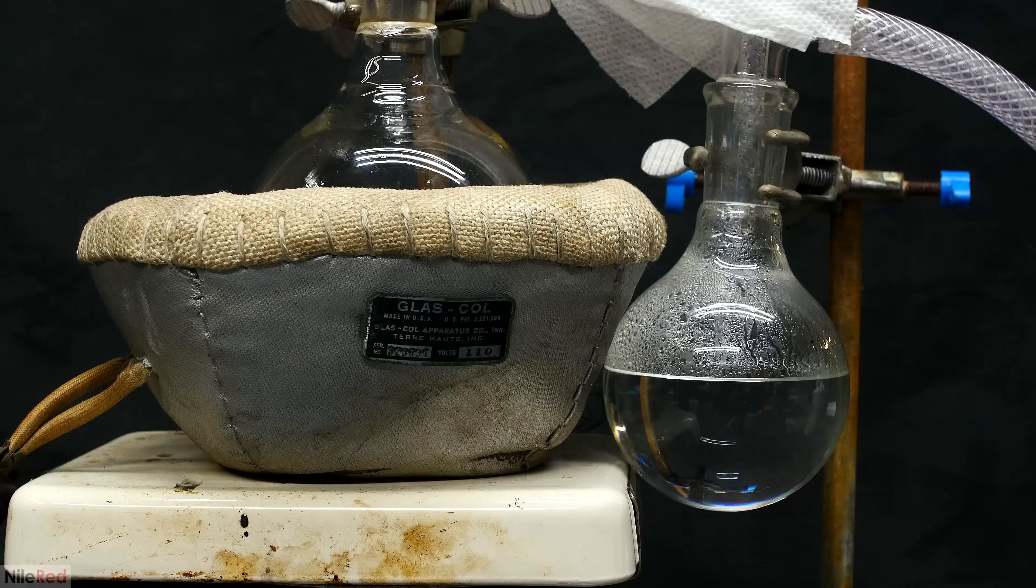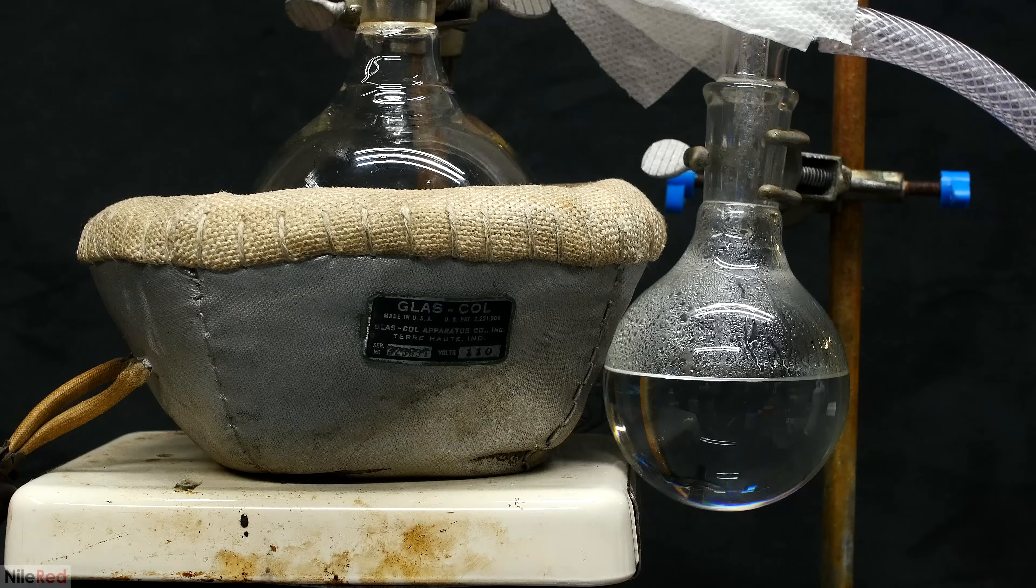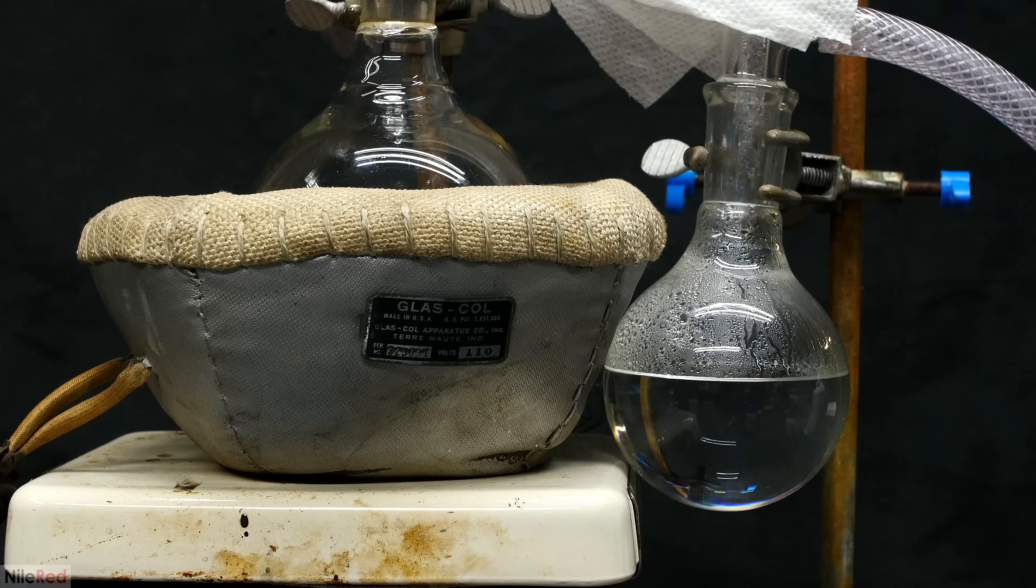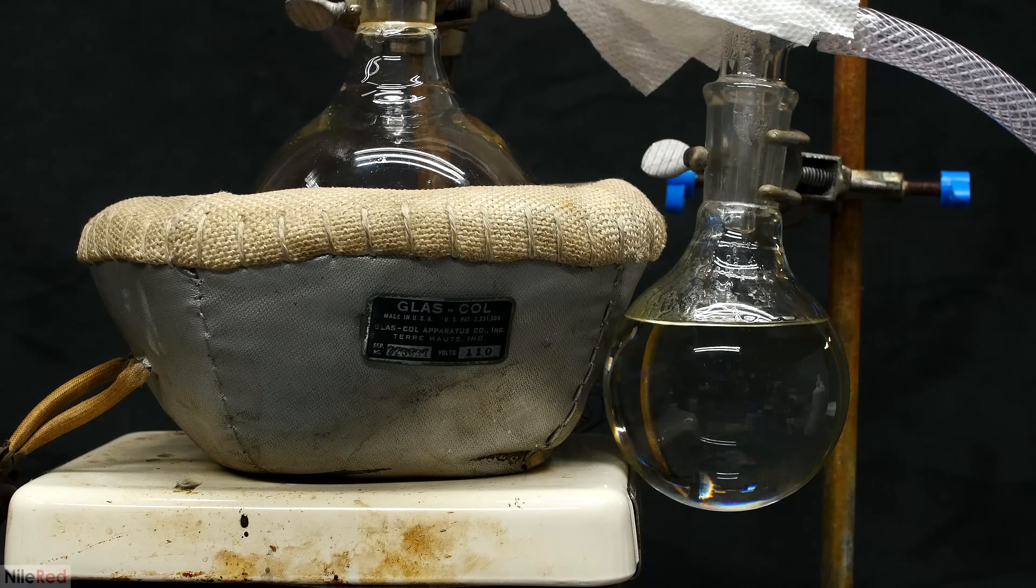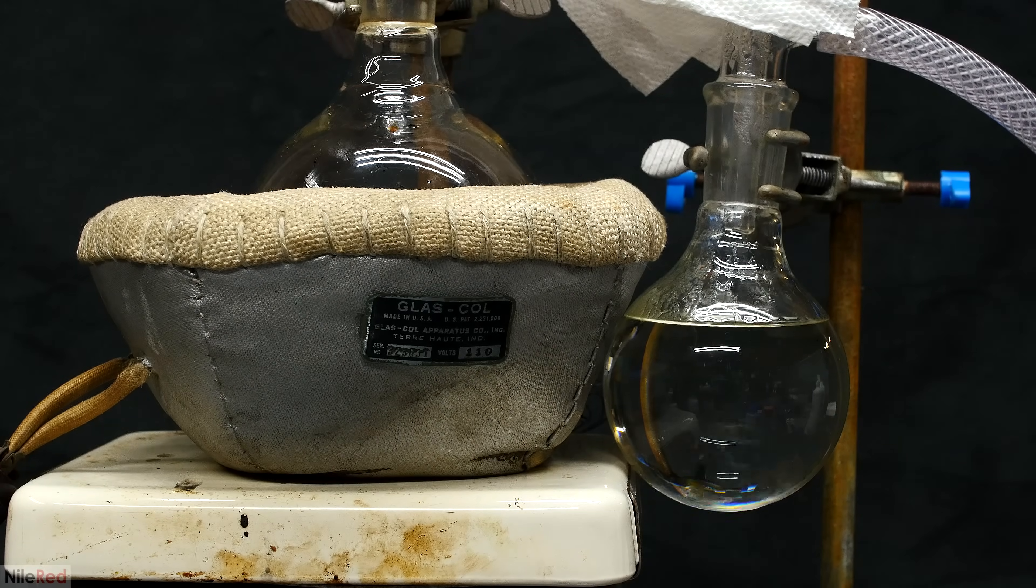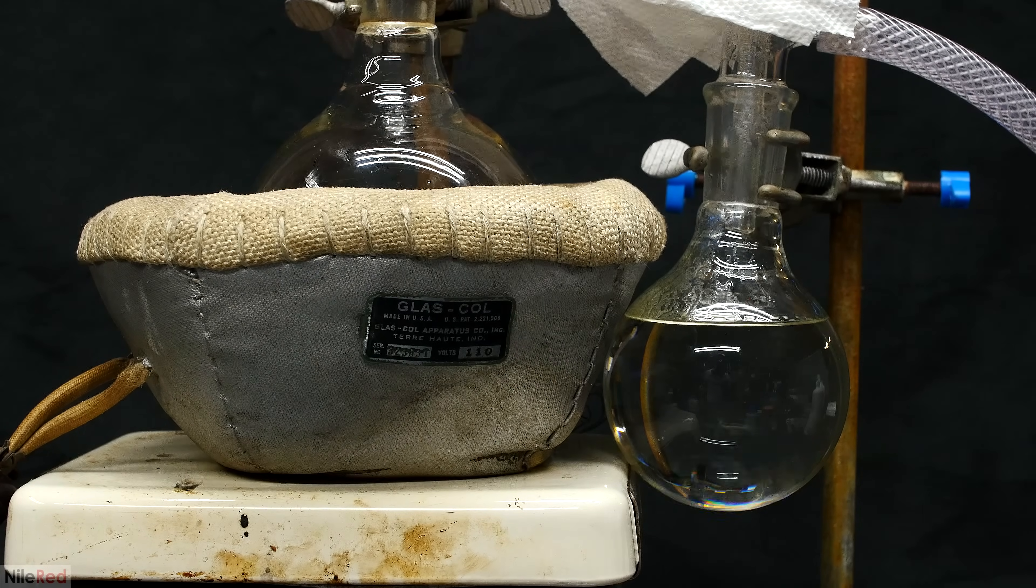Near the end of the distillation, I've collected a very nice amount of crystal clear colorless phenol. I was very excited about this, but unfortunately disaster struck, and I distilled things too far. I should have stopped it earlier, but by letting it go on a little bit too long, I started to collect some yellow stuff.